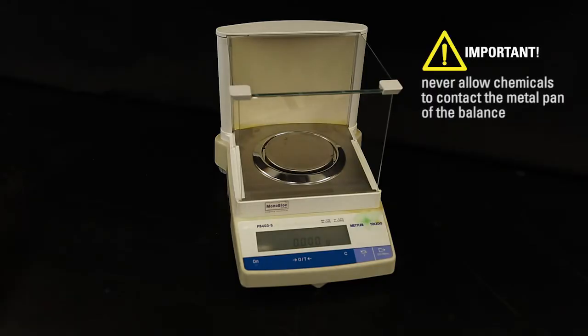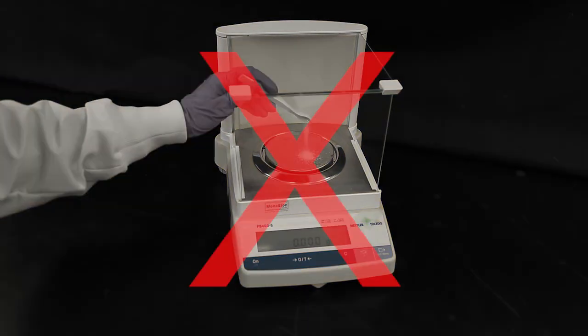Never allow chemicals to contact the metal pan of a balance. Always use weighing paper on the balance pan when not using a container.